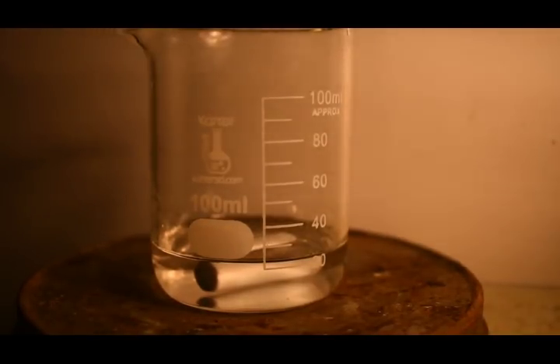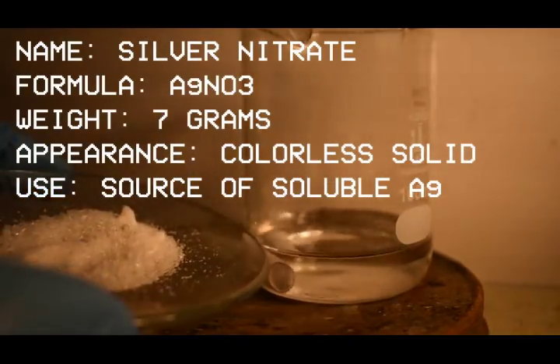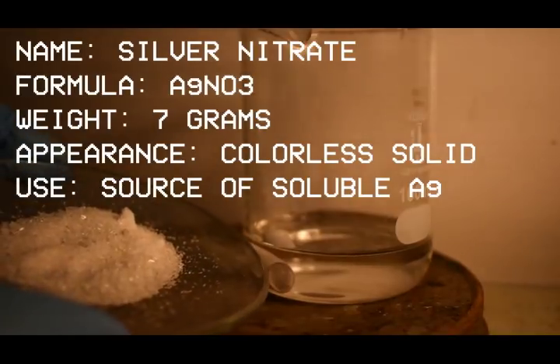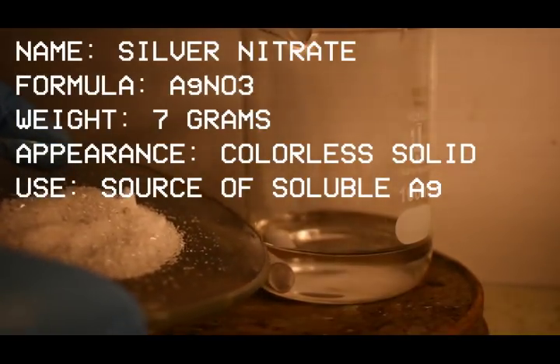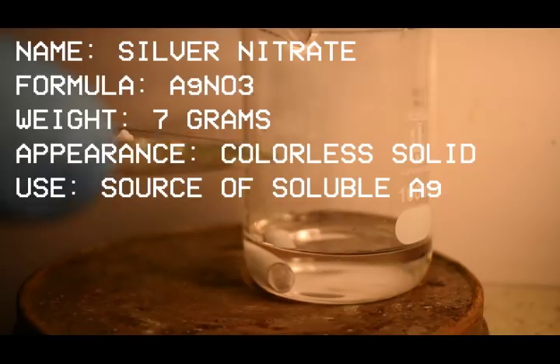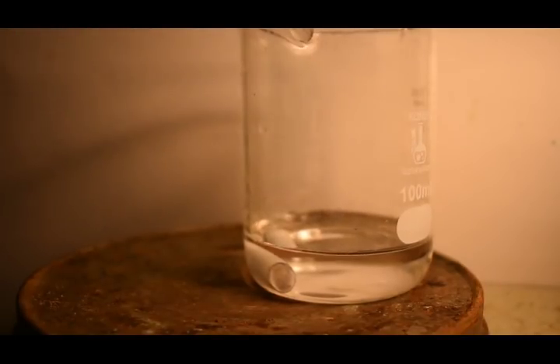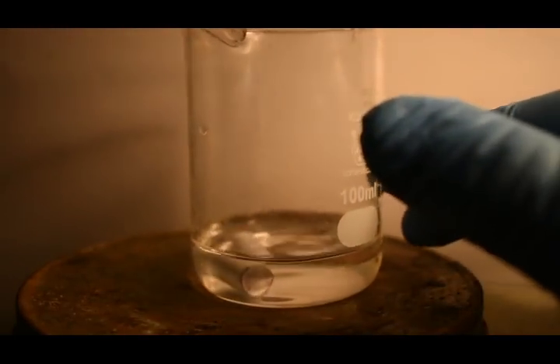With that being said, here I have exactly 7 grams of silver nitrate. You can see it's just a white, sort of off-white, colorless crystalline compound. I'm just going to add this to the water in this beaker here and get it to dissolve. Oh, another thing.